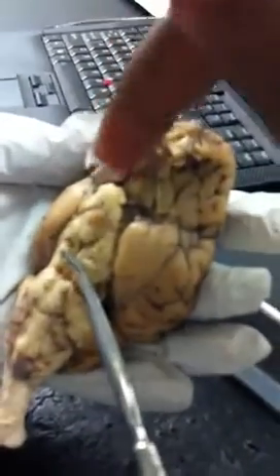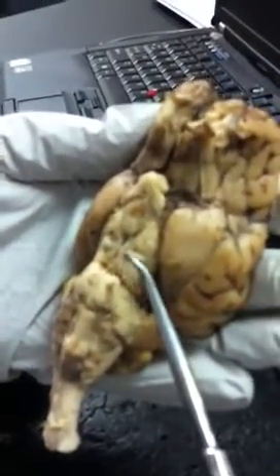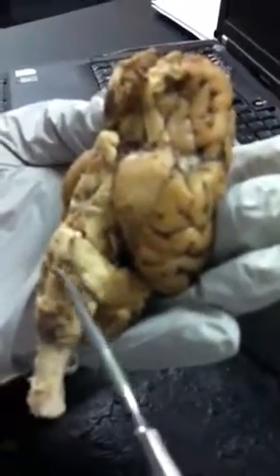And the ones up here is the first nerve. These are the second nerves. And this is the third nerve. This is the oculomotor. And then the fifth one would be here. But it got cut off, and the dura mater. And what was the name of that one? That was trigeminal. Yeah, it was trigeminal.